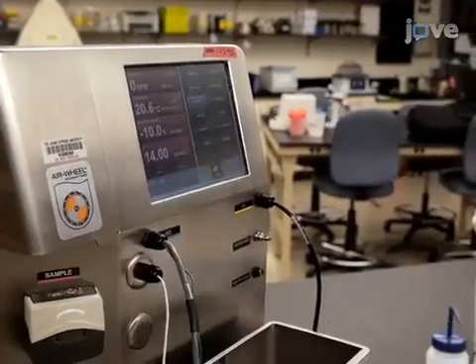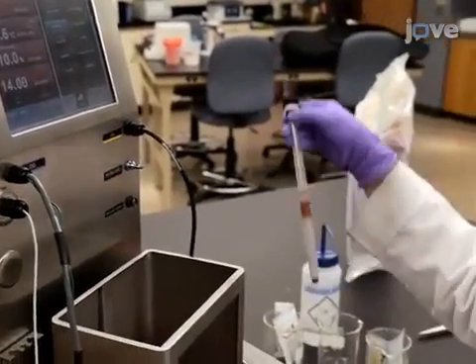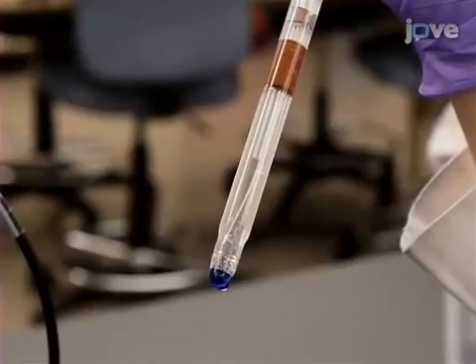Next, inspect the pH sensor and confirm the sensor tip is filled with electrolyte solution.